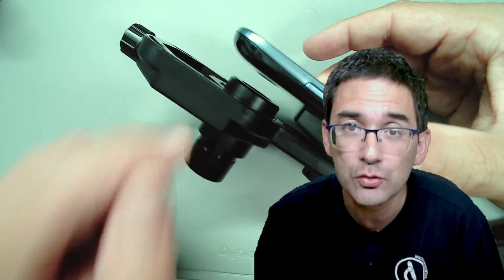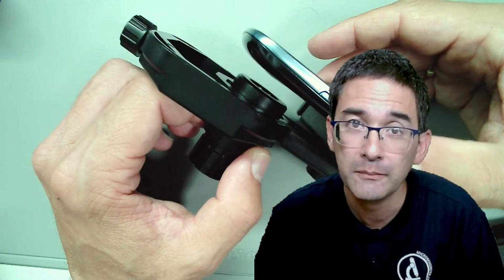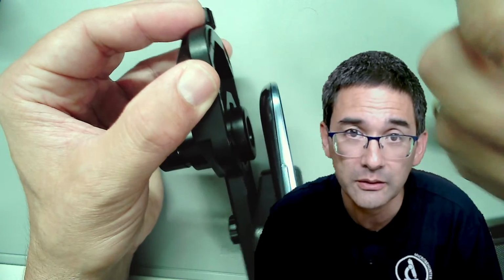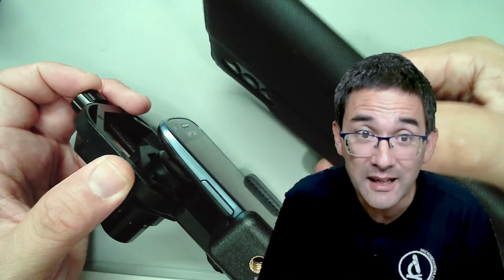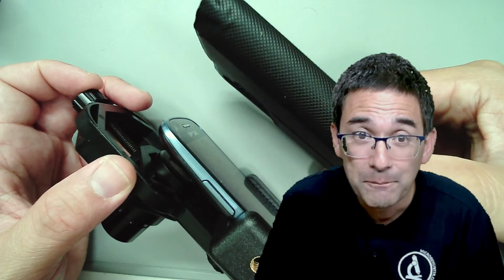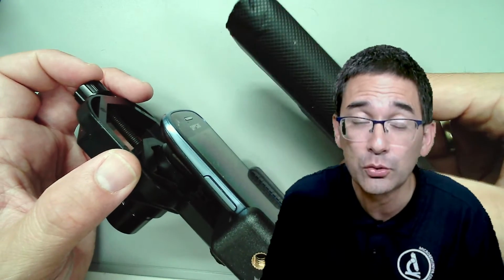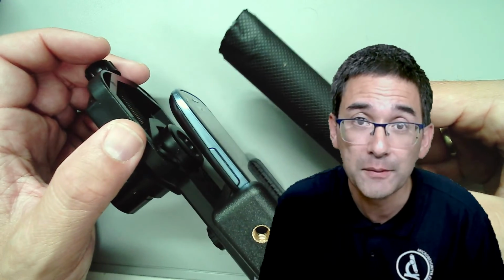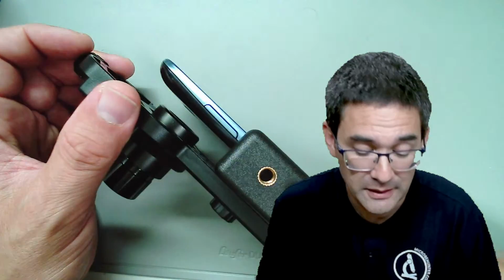This is extremely difficult to do if you just hold your mobile phone in front of the eyepiece, because the distance has to be correct. It's called the eye relief distance. I'm just going to use this one here as an example. The distance has to be correct. The tilt has to be correct. The XY position has to be correct. It's almost impossible, or very difficult, to line up the mobile phone without an adapter.